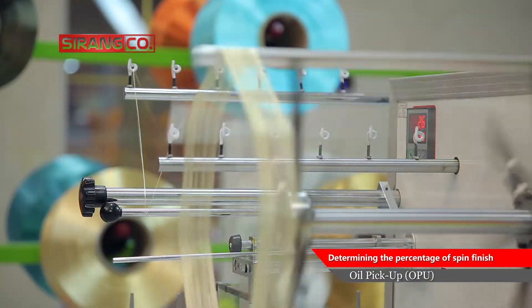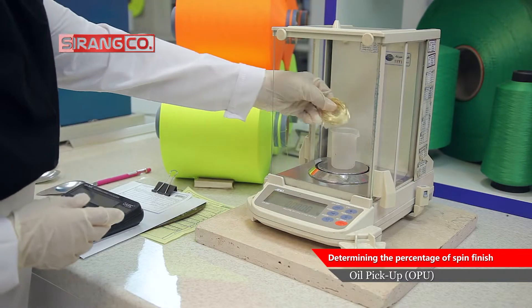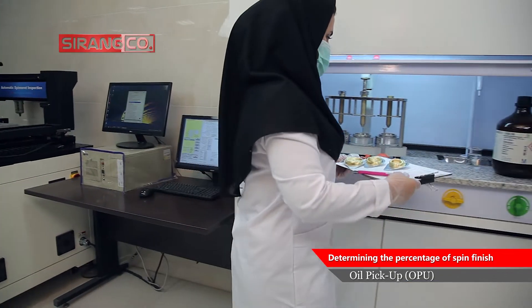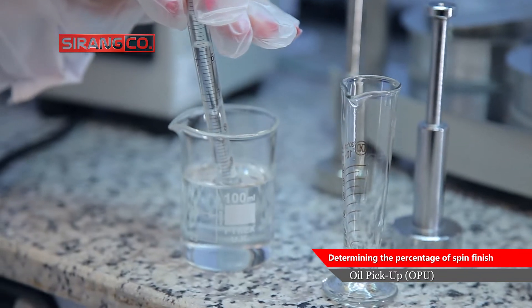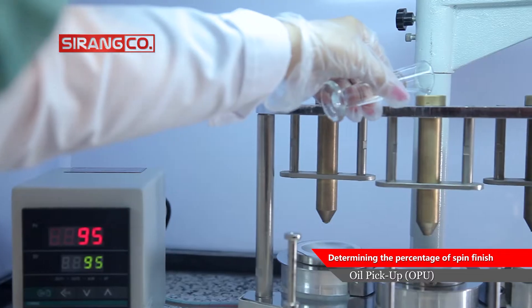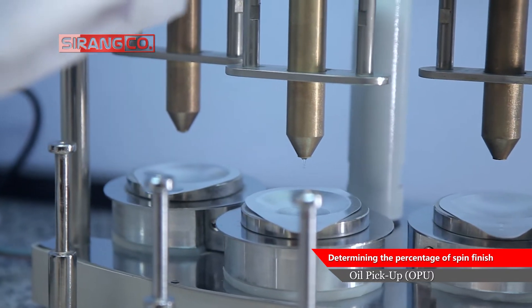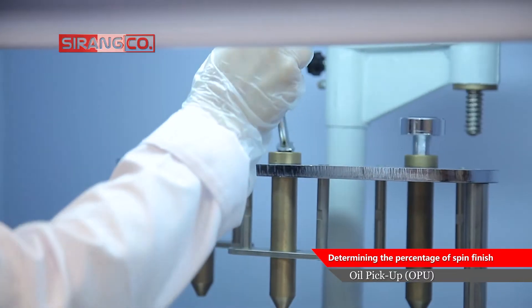In this method, three samples of yarn with a specific weight of about 2 grams are weighed exactly with an accuracy of 0.001 using an analytical balance and placed inside the tube of the machine. Then, using a measuring pipette, 10 cc ethanol is added to each sample in the tube and the oil on the yarn is allowed to dissolve in the ethanol.